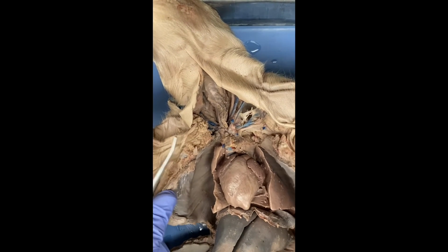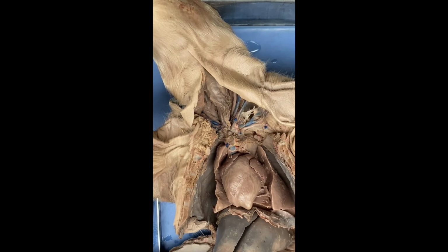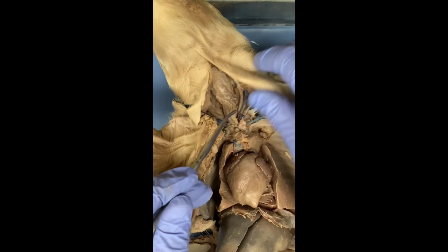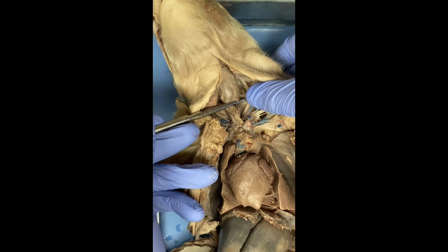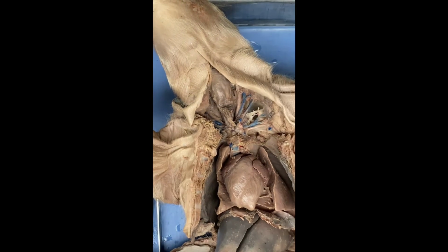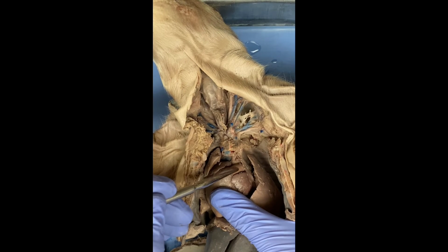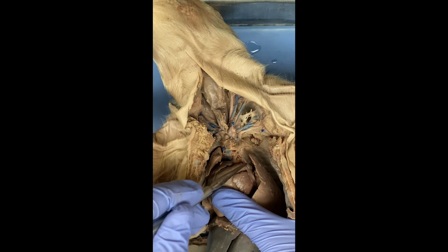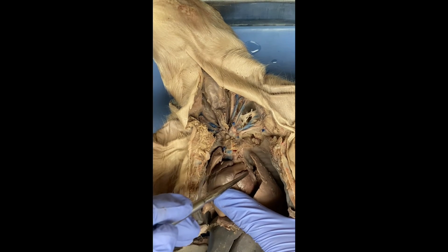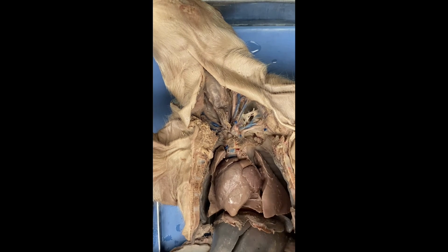All right. So now, the next is the carotid artery, which brings blood to the head. So that's going to be found right here. This one right here is the carotid artery. The pulmonary artery, also known as the trunk, is easiest to find on the heart, and it's going to be right here. Pulmonary relates to the respiratory system. It's going to carry deoxygenated blood from the right ventricle to the lungs.